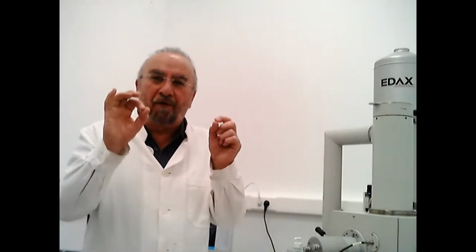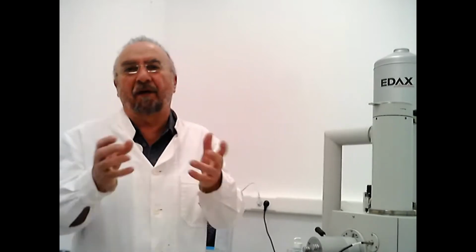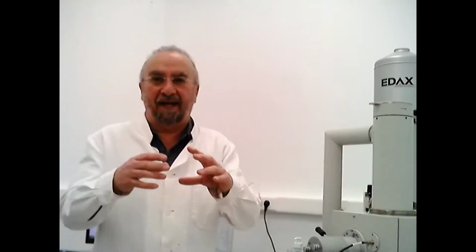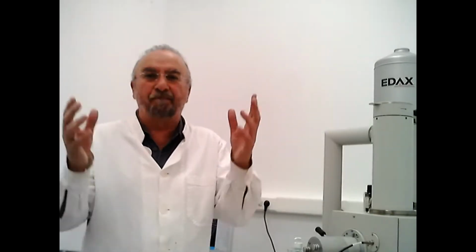Forensic scientists look for absolutely small, tiny particles, tiny evidence, and then they can analyze it in many different ways. But one of the most important tools that we have is the electron microscope. Now, the electron microscope is like a microscope. It gives us a picture, but it doesn't work with light, it works with electrons.